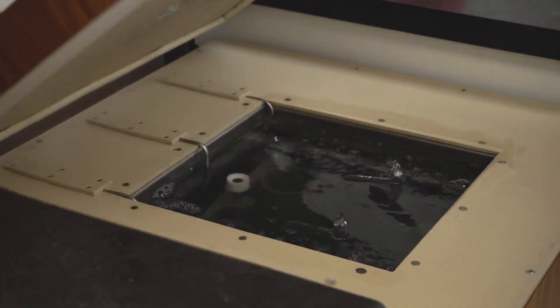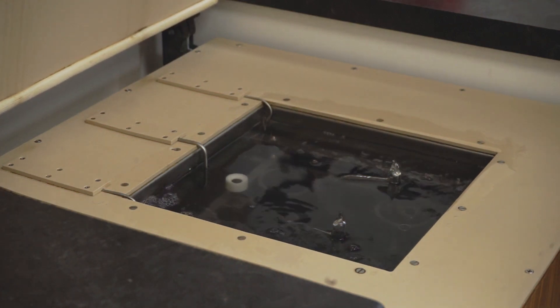To begin we must carefully remove the cell from the maintenance bath, but before we can do that we need to know how to lift the cell.